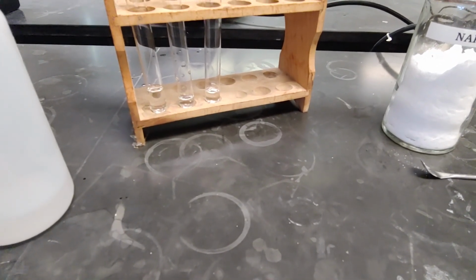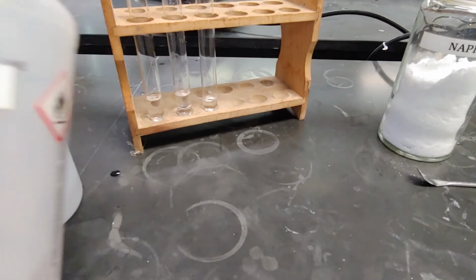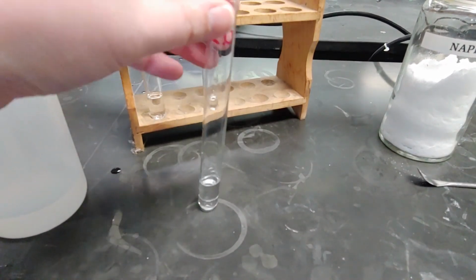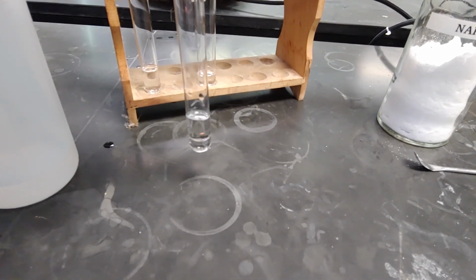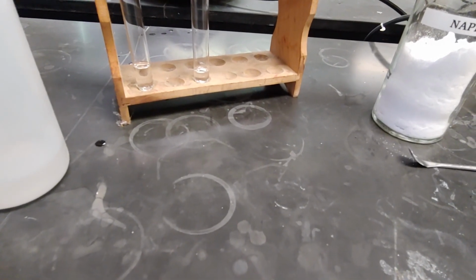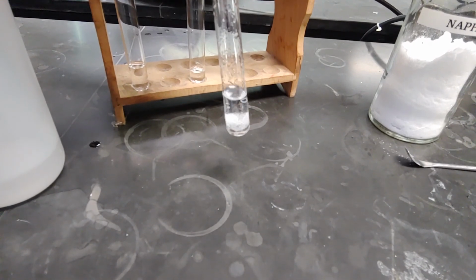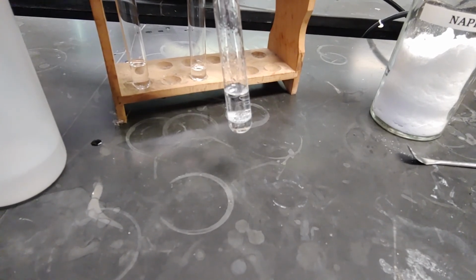Now let's look at water and toluene. Here, there's very clearly something that we call an interface. So you can see it's kind of like there's two layers, and the bottom layer of the test tube is separated from the top layer, and that is true, they are separated. So I'm going to shake them vigorously here, and now you can see as the liquids basically recover from the shaking, they go and form that interface again. The two liquids do not mix. That would be what we call immiscible.